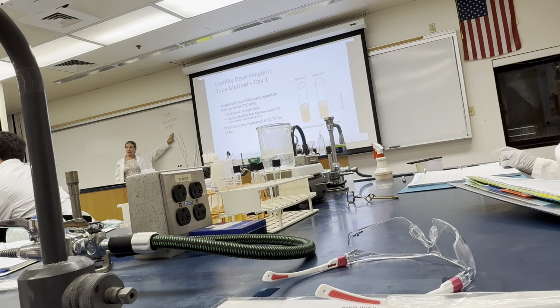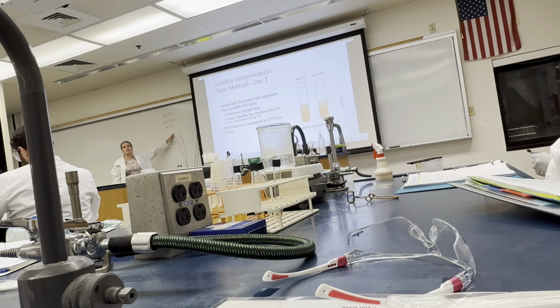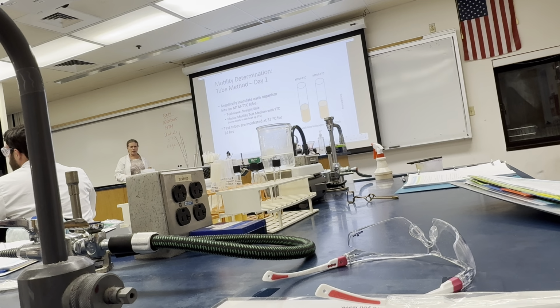Don't add the TTC. Then, of course, you'll have your initials because you're each doing one of these. And what else, guys? There's 37 degrees Celsius. And then, of course, the organism, which will depend upon which one you assign to yourself. That's it.